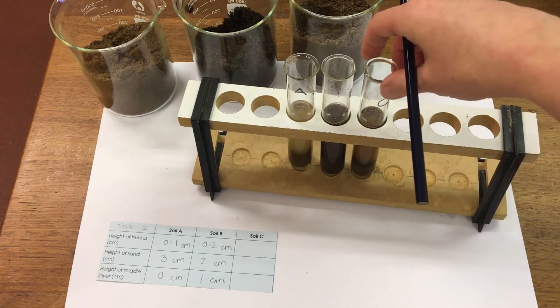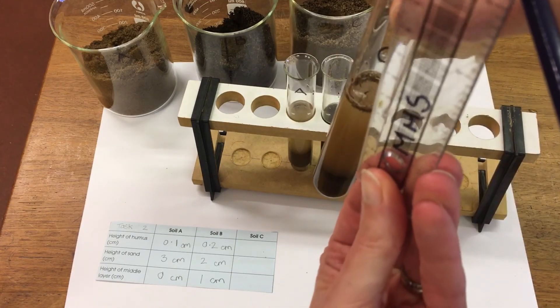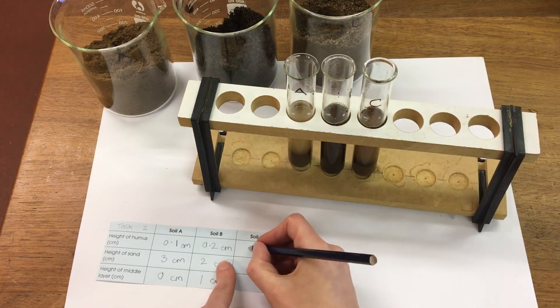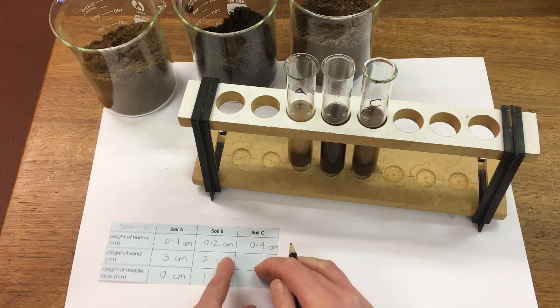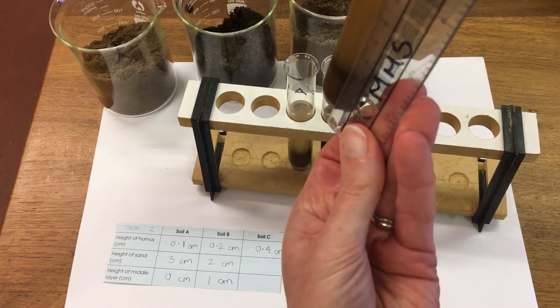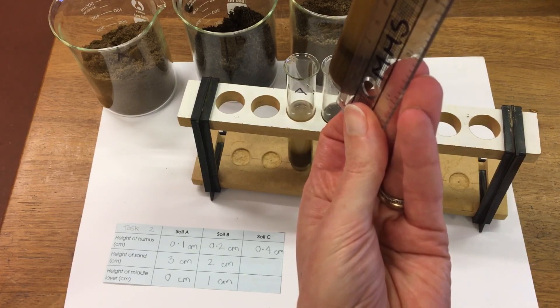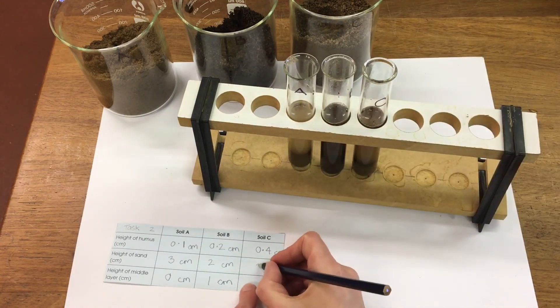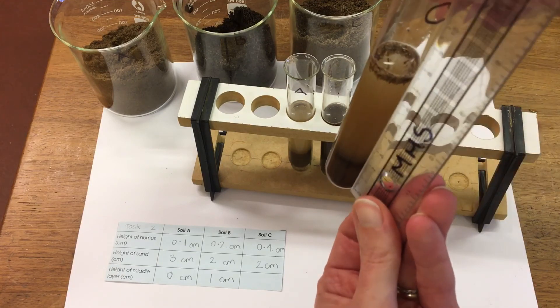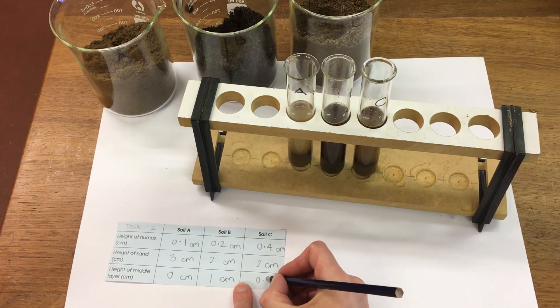And then for soil C, the height of the humus is 0.4 cm. The sand layer is right at the bottom, so that's about 2 cm. And then the middle layer on this one is 0.5 cm.